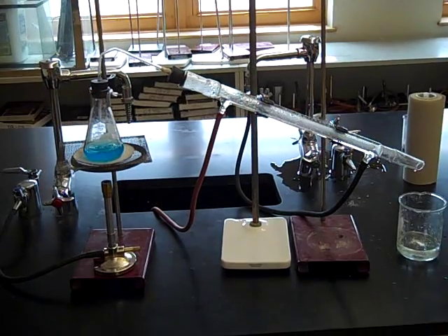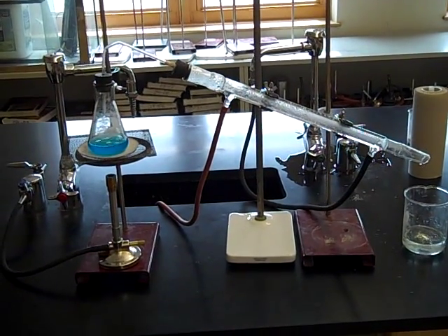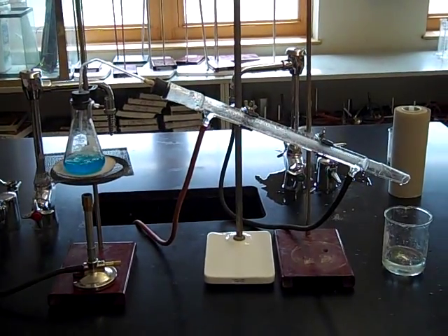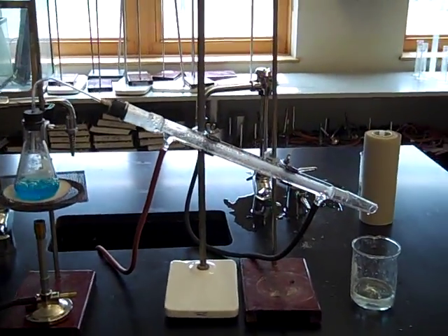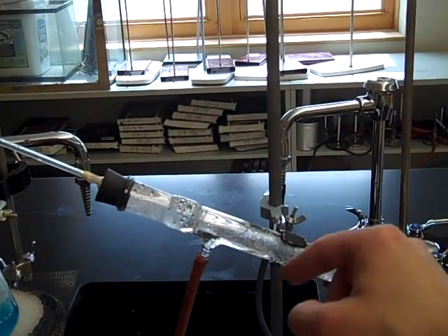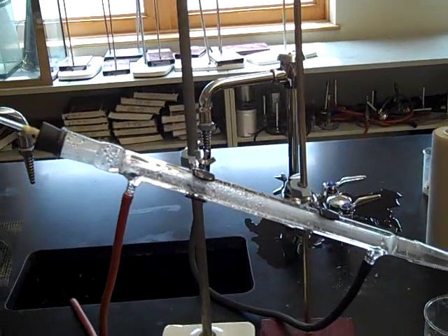So there's the whole setup. You've got the Bunsen burner on the left, the blue solution, that's copper 2 sulfate in water, and then you've got this long tube, right here, and that's called the condensing column.